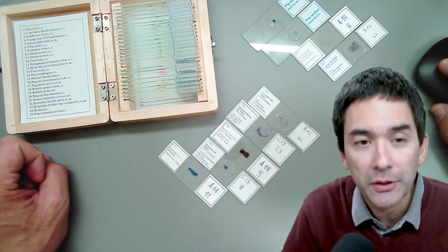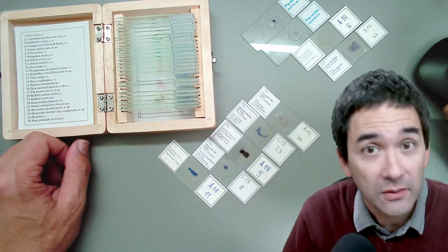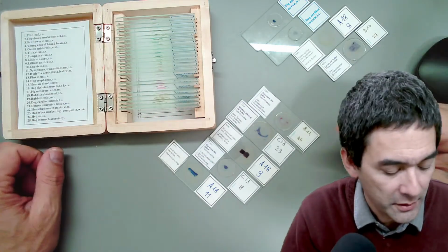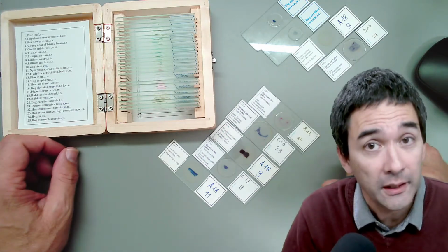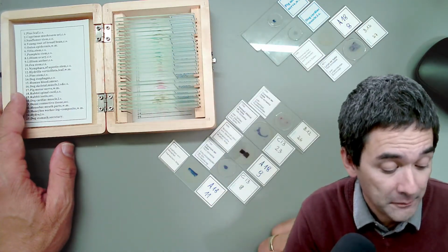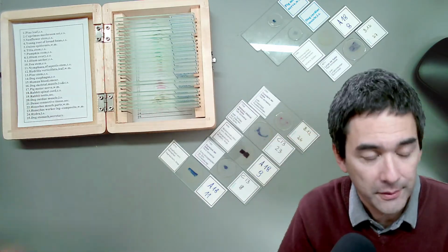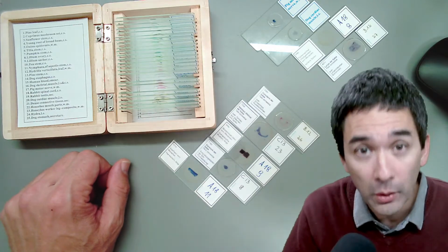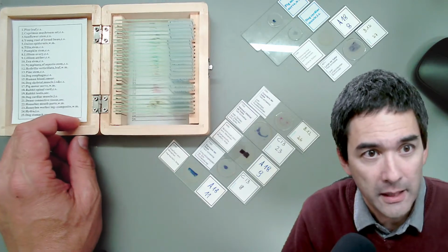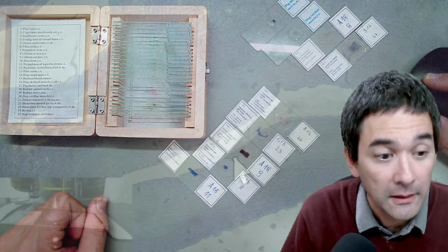Sadly, the slides I bought were dirty. Yes, that's one of the quality aspects I'm talking about. I mean, if you want, we can look at some of those as well. And yes, they were dirty, and it depends on the company and on the quality of the slide, and not just dirty on the outside, but actually dirty on the inside, where there is the permanent mount. So there is a price difference and there is a quality difference. However, I would say it doesn't matter. If you don't have a slide box yet, then just get one, simply to have something to look at, if you're interested in it.